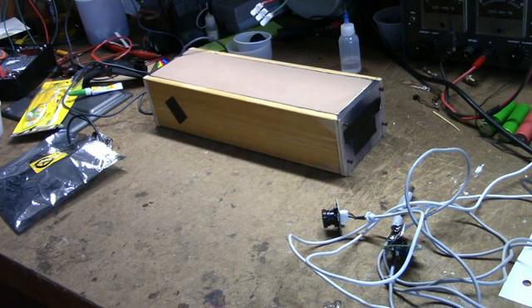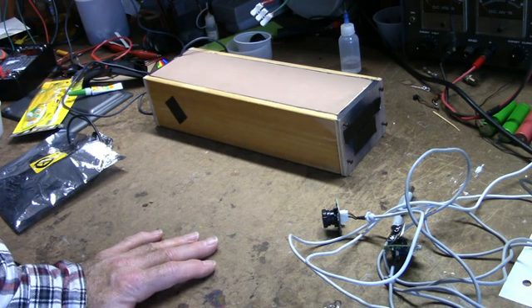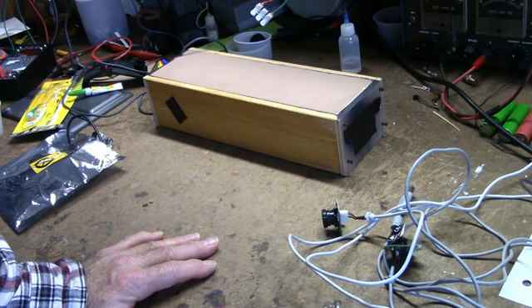If you just look up Theremino Spectrometer, you'll get a lot of links to it. There's quite a few guys that have done this. And the fella that designed the software made it quite easy. What you use is an old webcam. And I found the ones that work best for me are the old round ones that look like an egg.